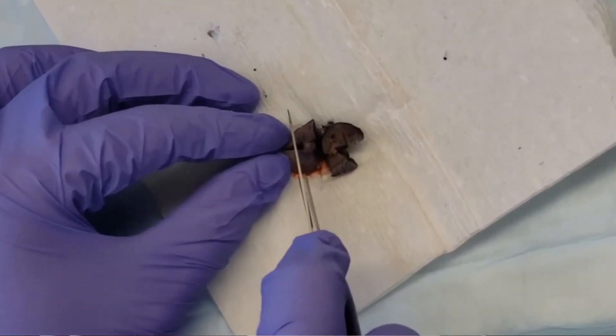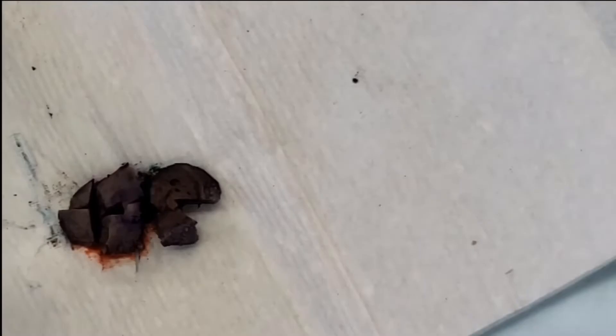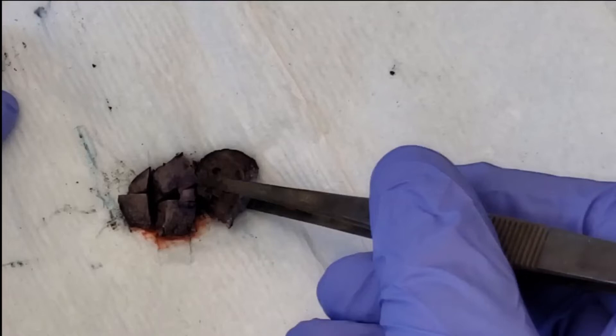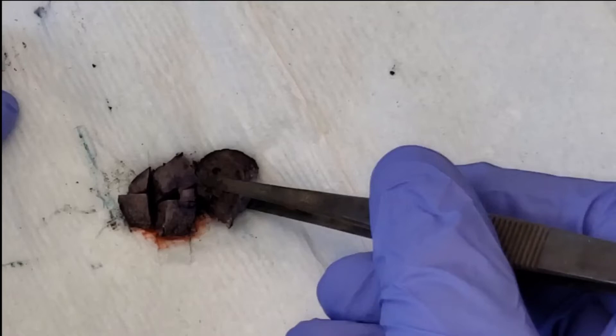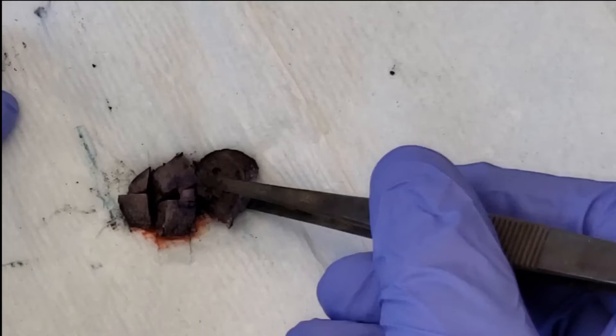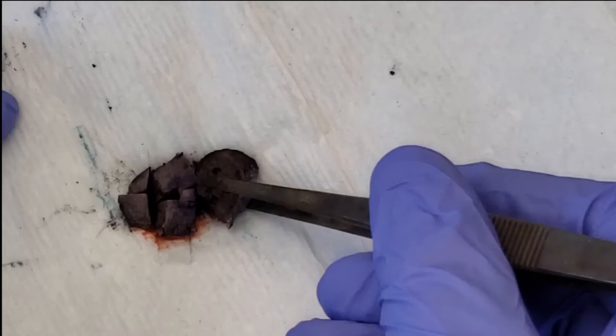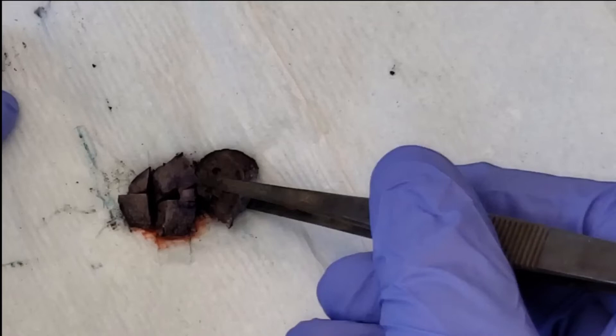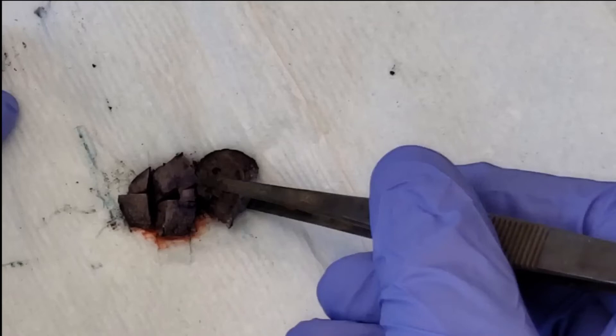Now I'm going to serially section the specimen, meaning section from one end to the other in three pieces. The two margins that we didn't take perpendicular sections from will show up in these serial sections, and we've submitted the entire specimen so we can look at all of it under the microscope. We don't always submit the entire specimen — sometimes we only submit representative tissue — but in a small specimen like this I usually just submit the entire specimen. There you have it: a real-life look at how we perform gross examination and processing for a small cancer resection specimen.